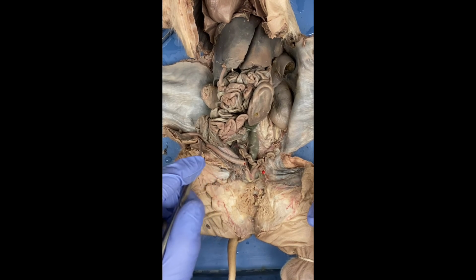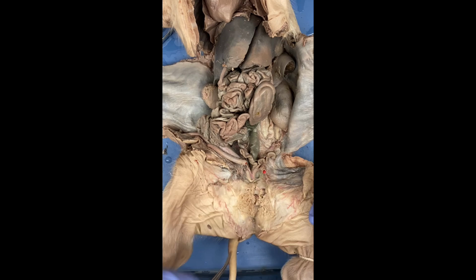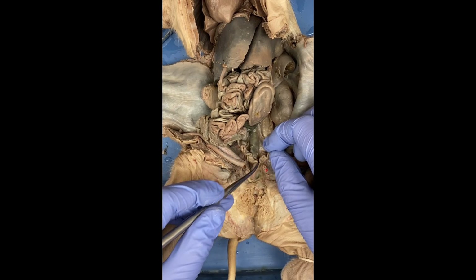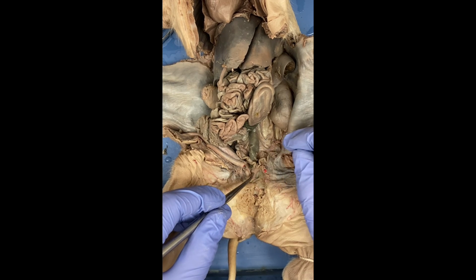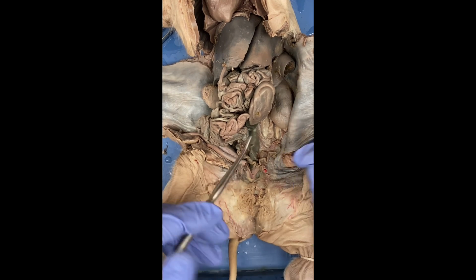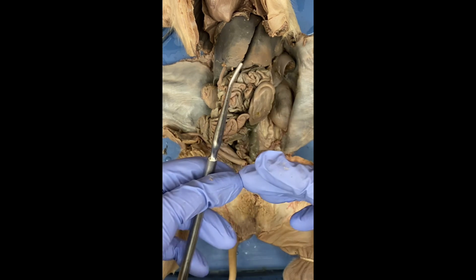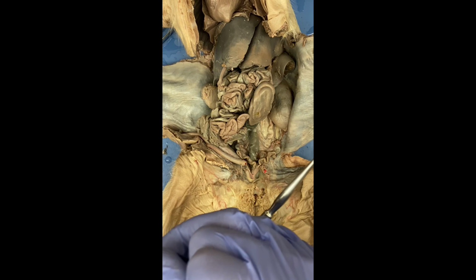Next, we have the cervix, which is right here. These two tubes go, and this is the cervix right here. The cervix is the junction between the vagina and the uteri. It dilates during heat, but is usually constricted during the remaining of the estrus cycle.